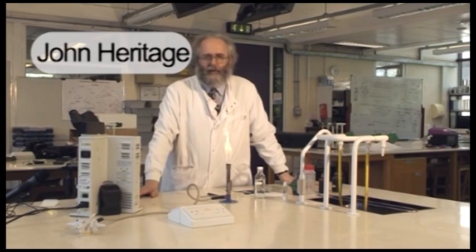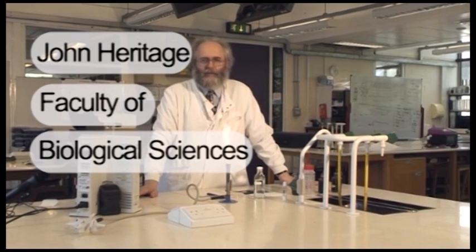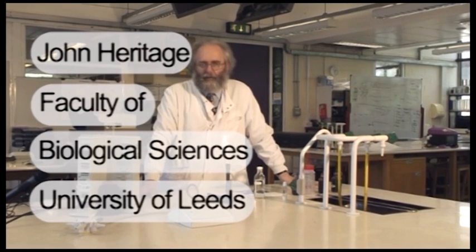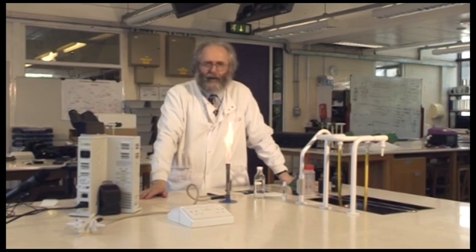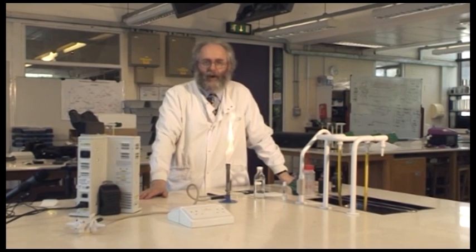Hello, I'm John Heritage, Senior Lecturer in Bacteriology at the University of Leeds. Today I'd like to show you how we visualize bacteria which are very small and require a microscope to see. They're also not colored, so we have to color them up using what's known as the Gram stain.